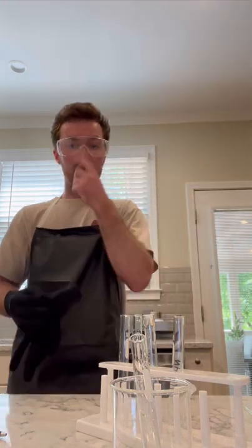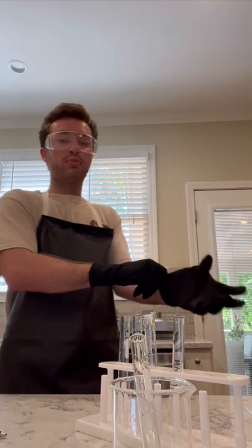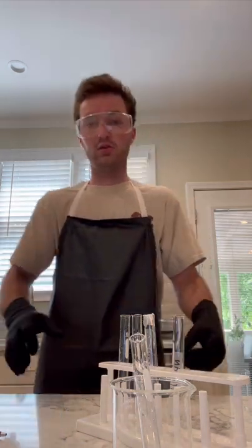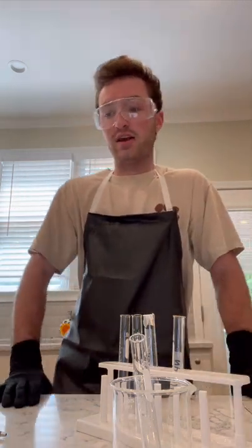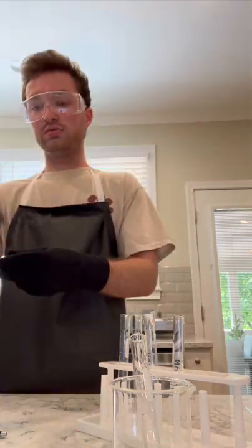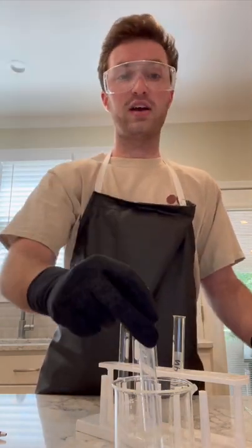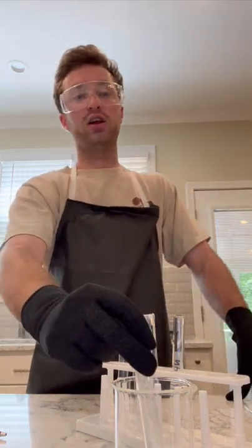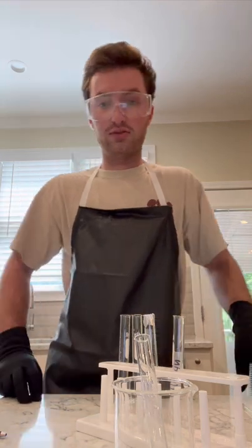All right, so I am back for my second reaction. This is the part 2 reaction in my lab design. We're still on part 5, and more specifically, this is part B of part 5 in my lab design notebook. So you can see right here, part B. What I'm going to do, I started off by measuring 2 milliliters, this reaction is, first off, 6.0 molarity of hydrochloric acid with 7.5 molarity of ammonium hydroxide. Sorry, I forgot to mention that.